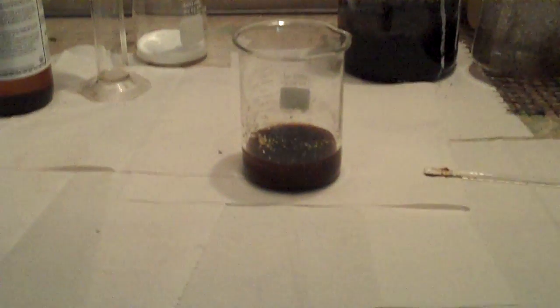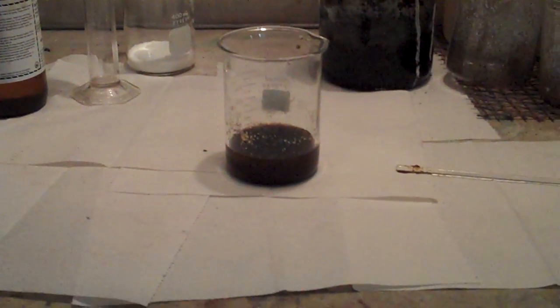What's going to happen? The thing is, actually let's have a take a look at it and then we'll discuss it. Cool. It's going to take about a minute. It's getting darker and darker.